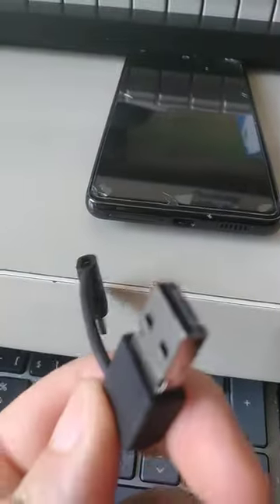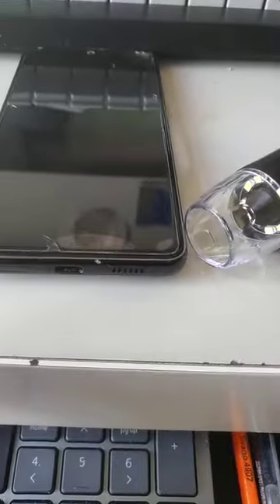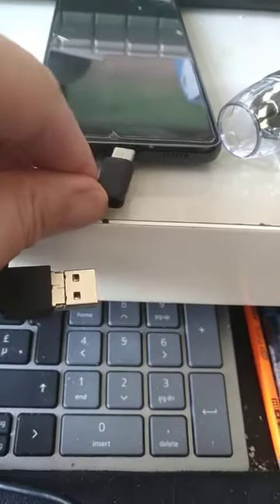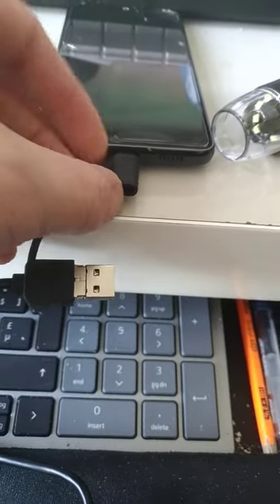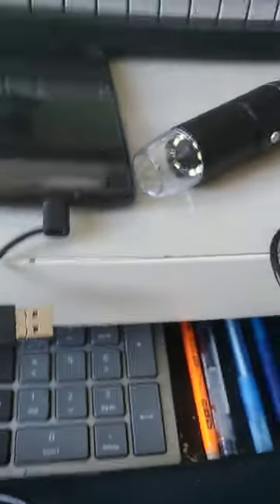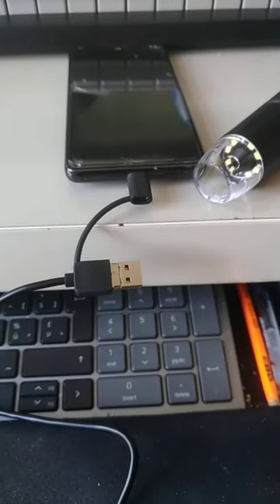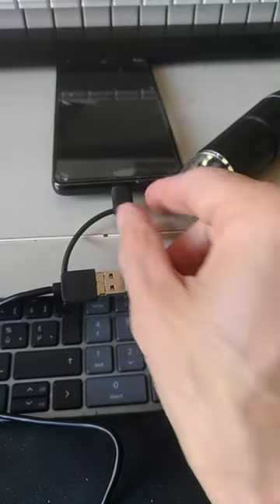Okay, so here we are back. Now I've removed the adapter. So now I'll put the regular USB-C, the one from the device. And you'll see that nothing happens and it does not power on. Yep, there you go. See? So clearly, USB-C does not work, and I'll do one last try just for the hell of it on my laptop.